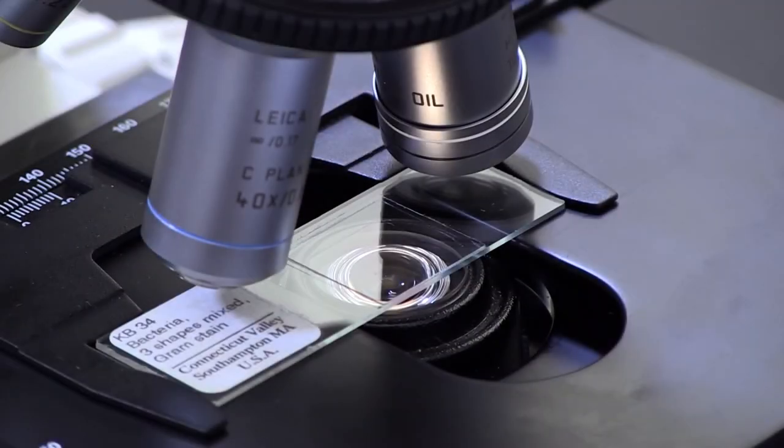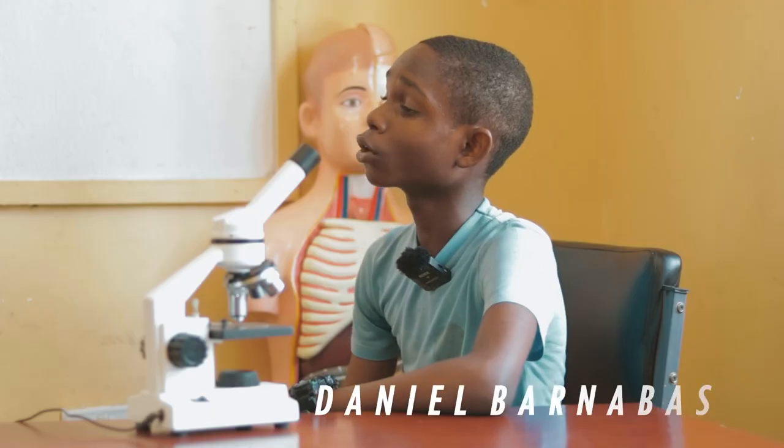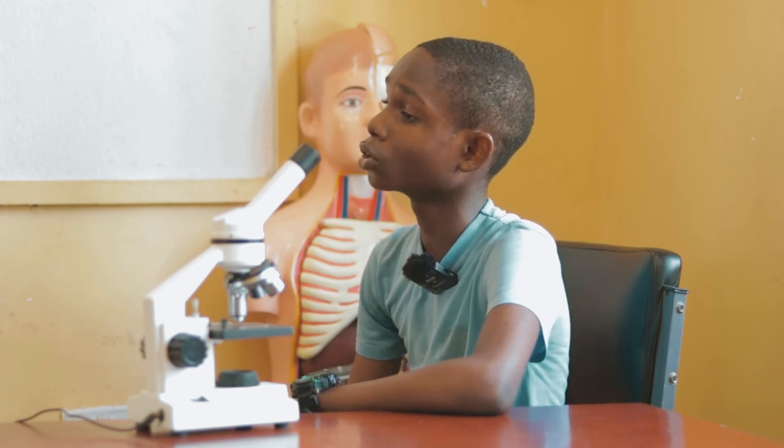This is the microscope light source, which is located at the base and captures light from an external source.